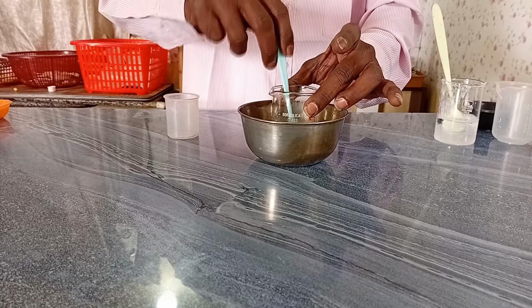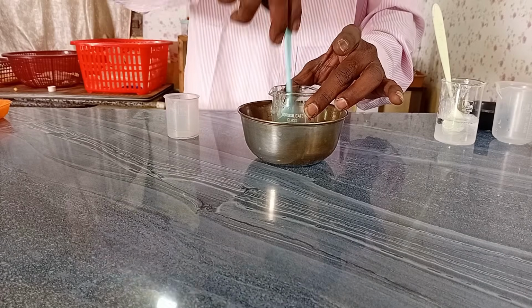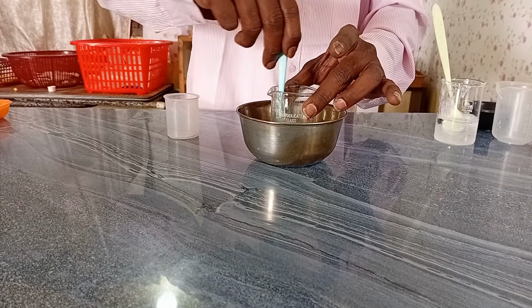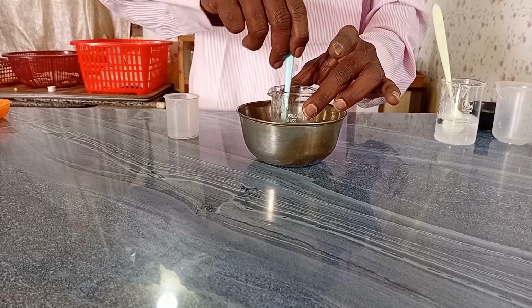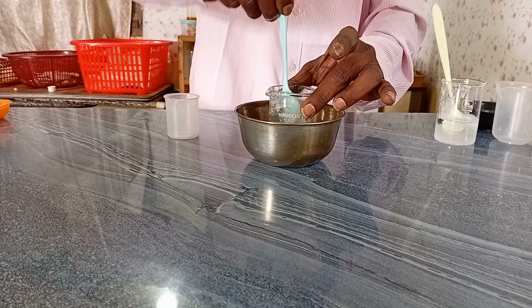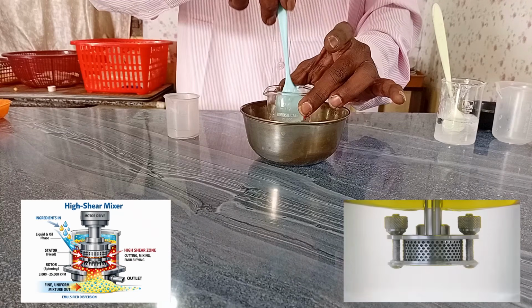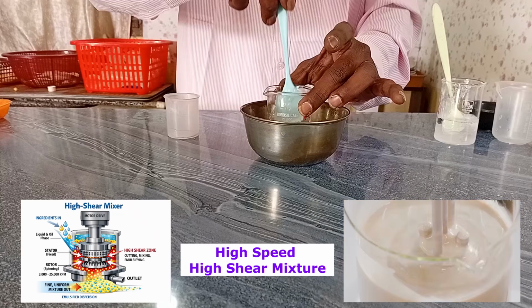Now let us discuss the reason. The reason is I am not using the proper heating system as well as blending system, so I am unable to achieve a homogeneous medium. In an industrial process, they will use a proper blender, a high speed shear mixer.